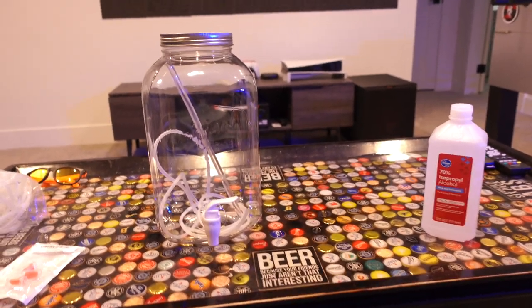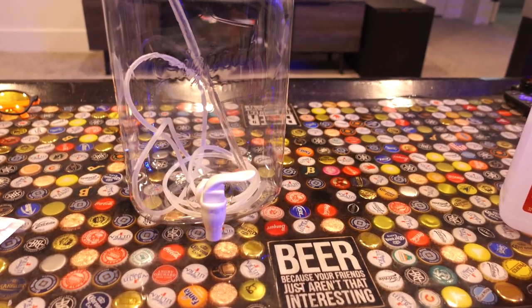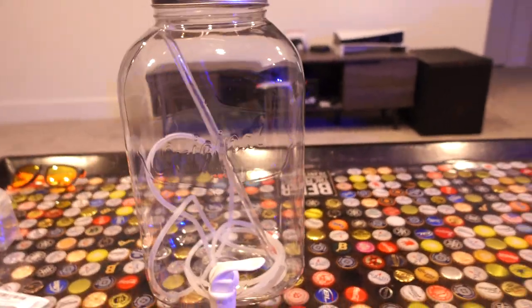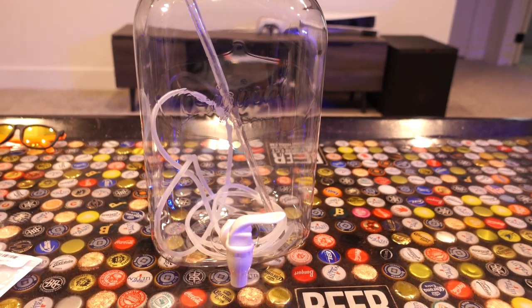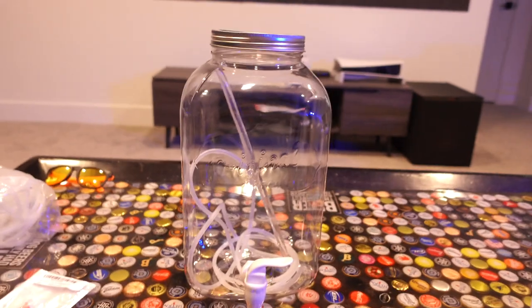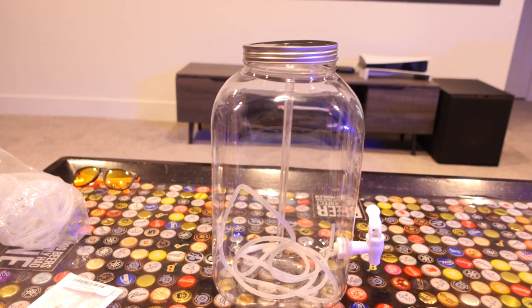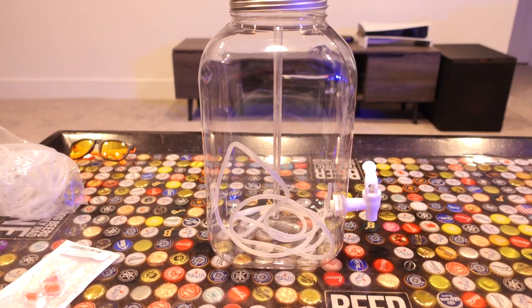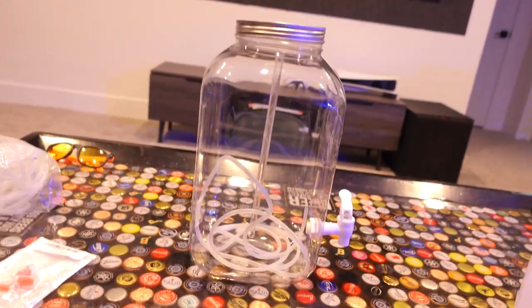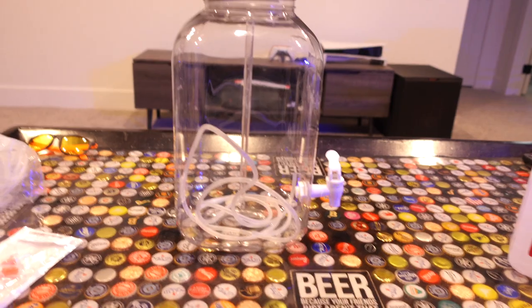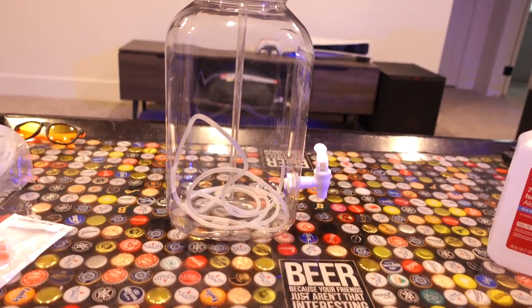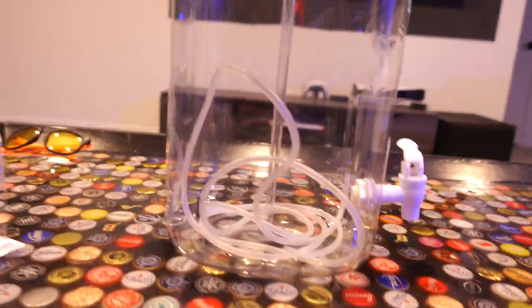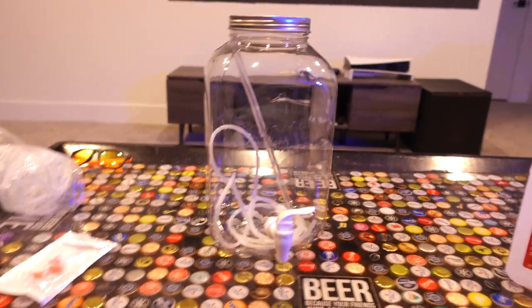So I have now sanitized everything thoroughly. I do need to clean the rigid tubing that's inside of the container right now, but I am going to put some RO water in here to make sure that it doesn't leak at the spout. Everything is wiped down. Nothing smells like alcohol. I made sure of it. I actually wiped everything down with alcohol first and then I wiped everything down with RO water afterwards a couple of times to make sure that all of the alcohol smell was gone, but everything is still sanitized.